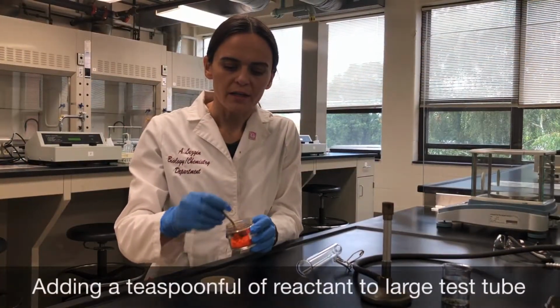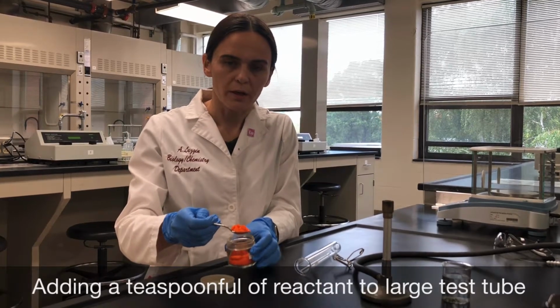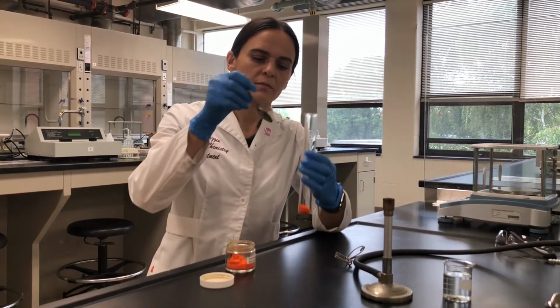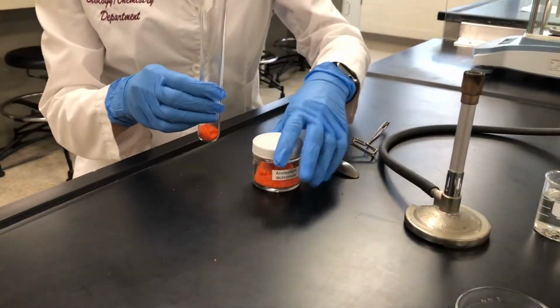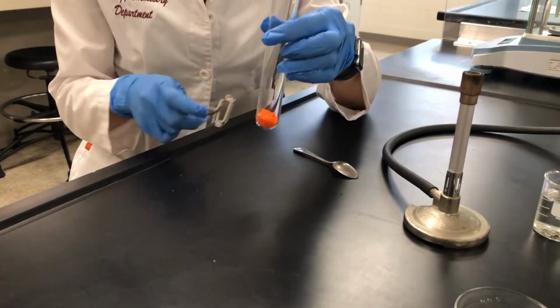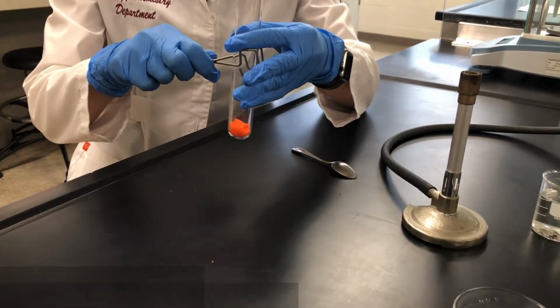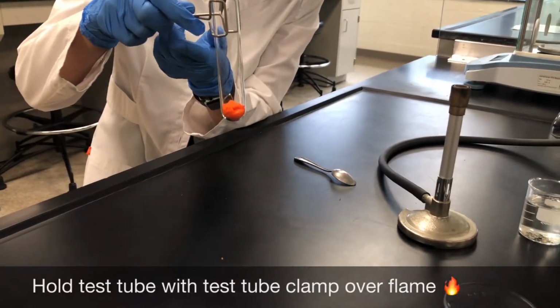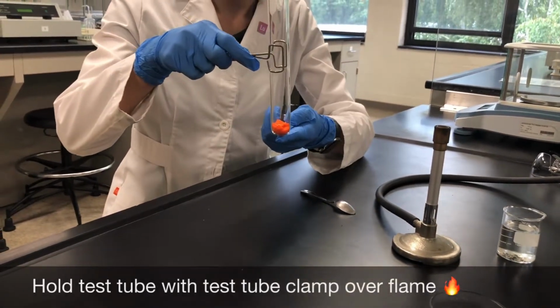Now I'm going to add a teaspoonful of the ammonium dichromate into my very large test tube. Okay, this side. What I'm going to do next is I'm going to hold the large test tube containing the ammonium dichromate with a test tube clamp or holder, and I'm going to hold it over the flame and ignite it.